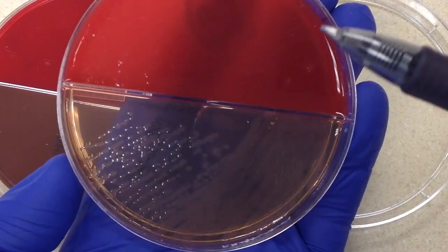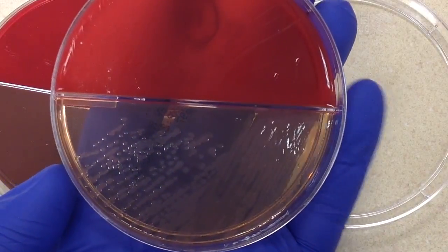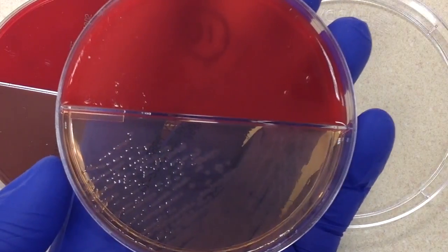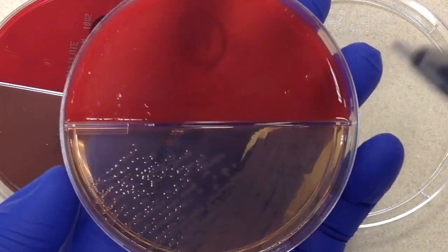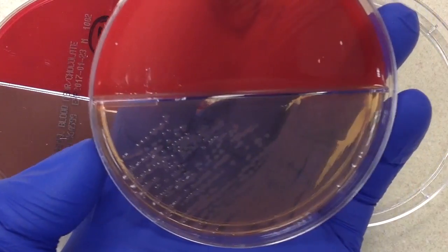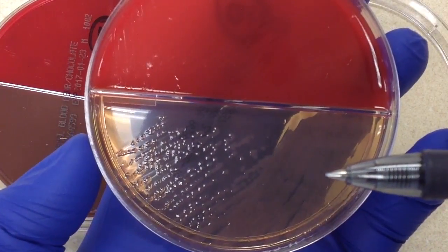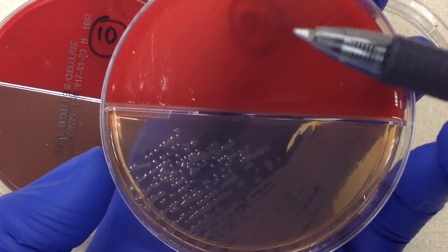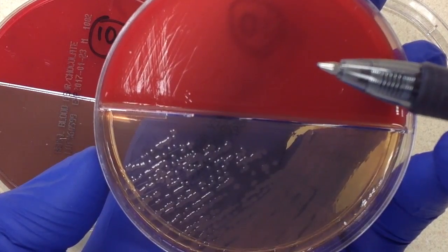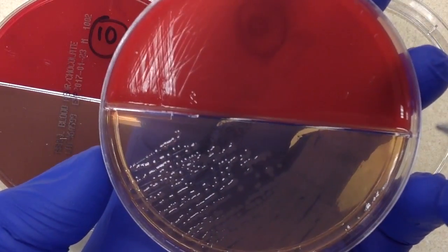The CNA has no growth, and the MacConkey's does have growth. CNA is a selective medium selective for gram positives. Since nothing is growing on it, that tells me there's no gram-positive normal oral flora present — and I have this gram-negative organism growing on MacConkey's. If normal flora were present, we'd expect to see it on CNA since it tends to be gram positive. This strengthens my belief that there is no normal oral flora in this culture.